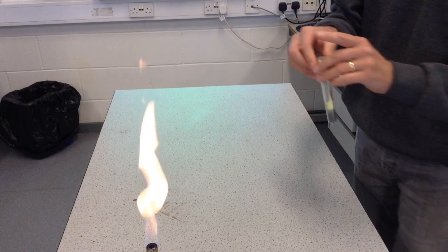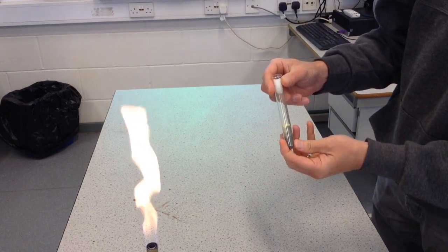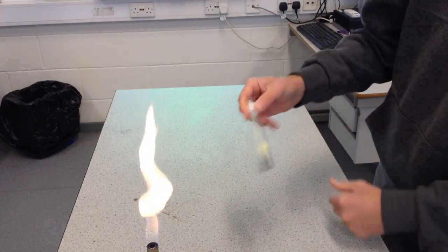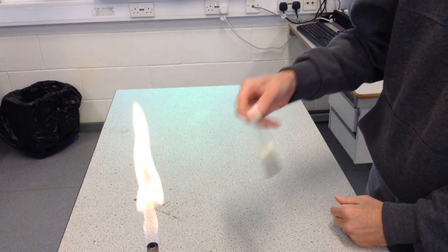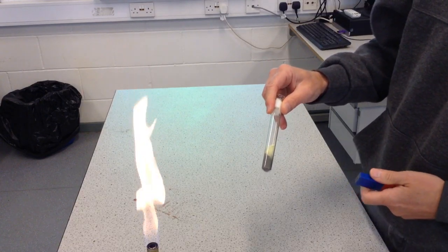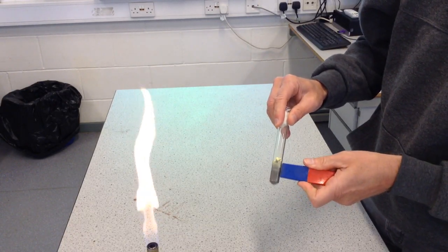When you mix them together — like we've already done here — you can see the iron and the sulphur together in the tube, and the atoms are now starting to get amongst each other. I'll give them a bit of a shake to mix them up a little bit more. But the thing about a mixture is that those atoms have not joined together yet. I can show that using a magnet, because one of the properties of iron is that it's magnetic — it's one of the magnetic metals — and sulphur is certainly not magnetic.